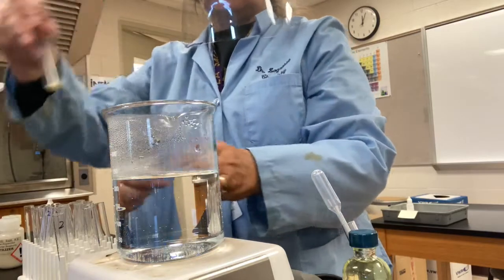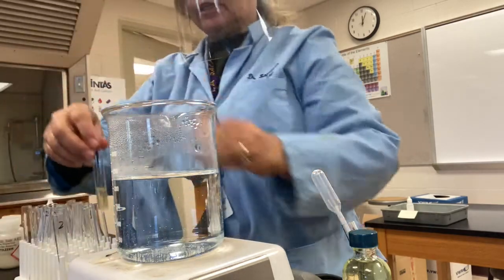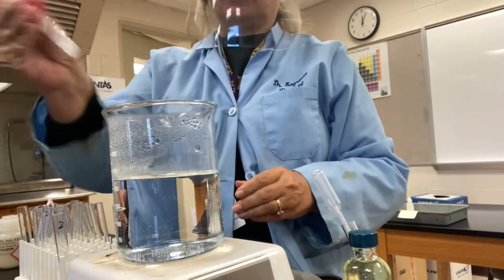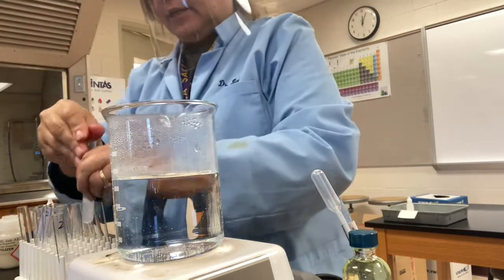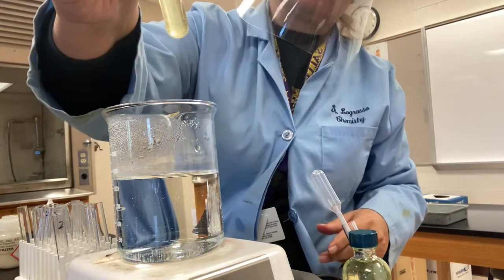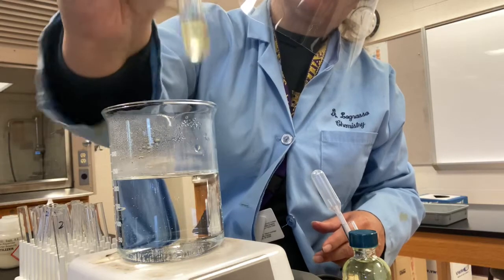And then some water in our fertilizer. I want to shake these up so that they dissolve as well as possible. The sodium phosphate is already in a water solution, so I don't shake that up, but I'll shake up the detergent. See how it's getting all bubbly because it's detergent. And then the fertilizer. Probably won't all dissolve. There's some insoluble substances in the fertilizer, I think. We will see. I'm not going to worry too much if there's a little bit undissolved.